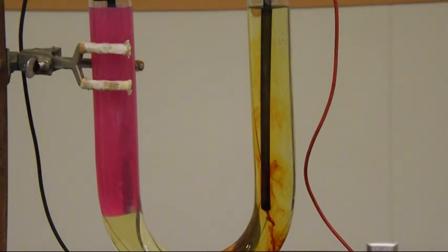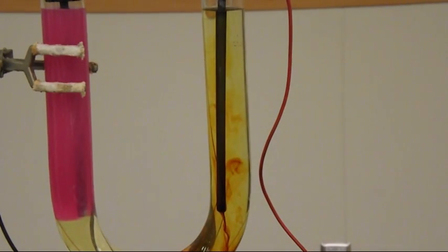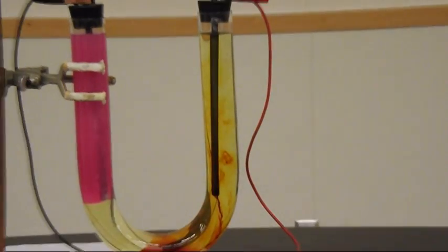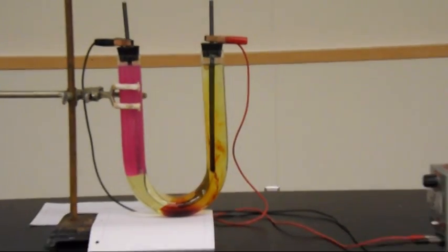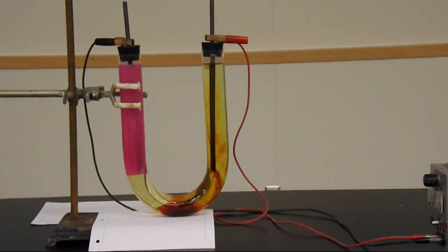So I'm just going to zoom this out just a tiny bit. You can see the entire cell setup in the region right there. So what's actually occurring?